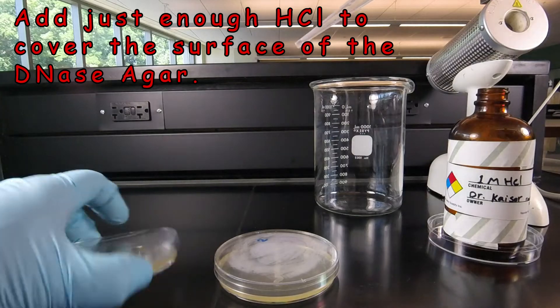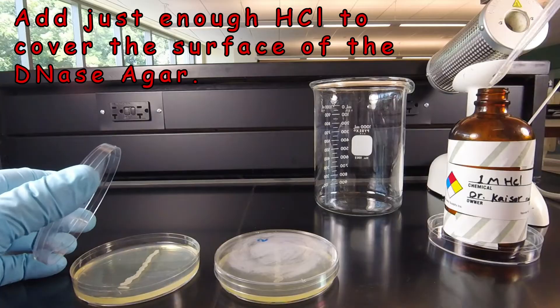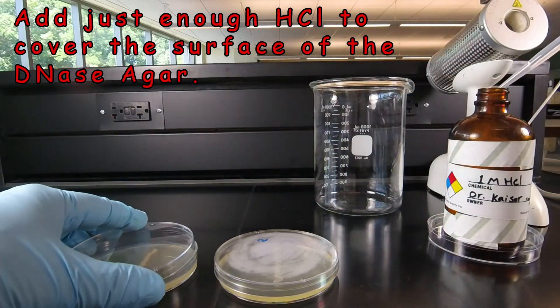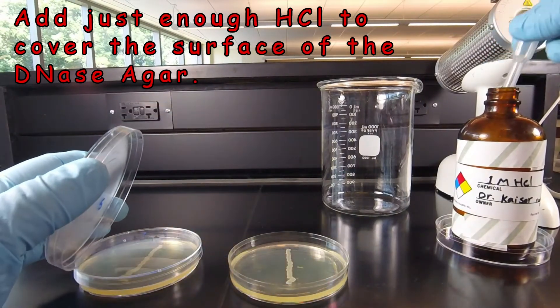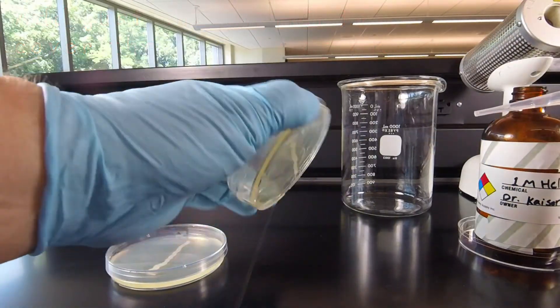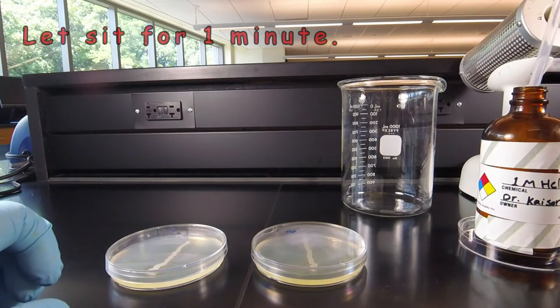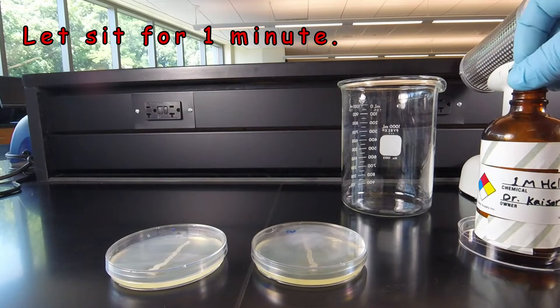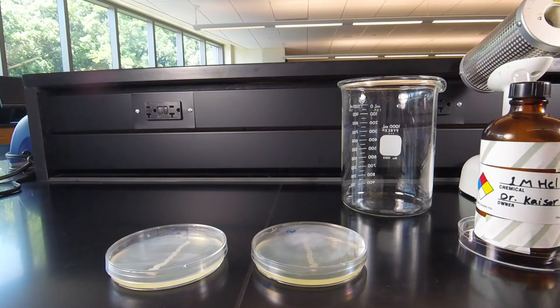We put on some acid, swirl it around a little bit, see if it's covering the surface, and add just a little bit more. We'll do the same thing with our other unknown. Now we're going to let that sit for about a minute, and then we'll look to see whether or not the DNA in the agar has been hydrolyzed by the bacterial enzyme DNase.